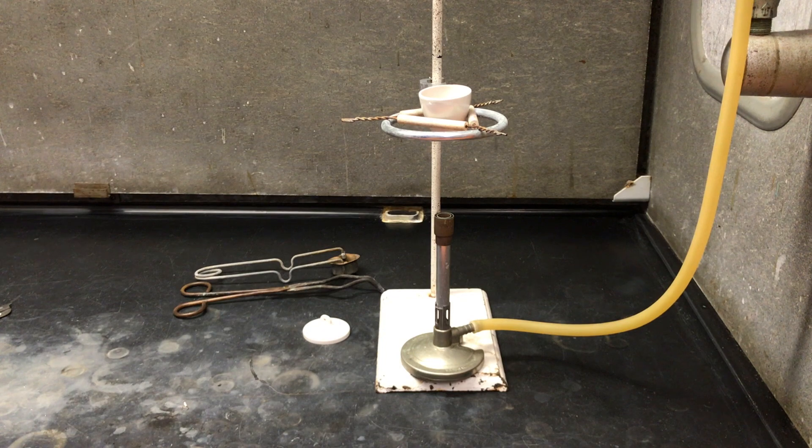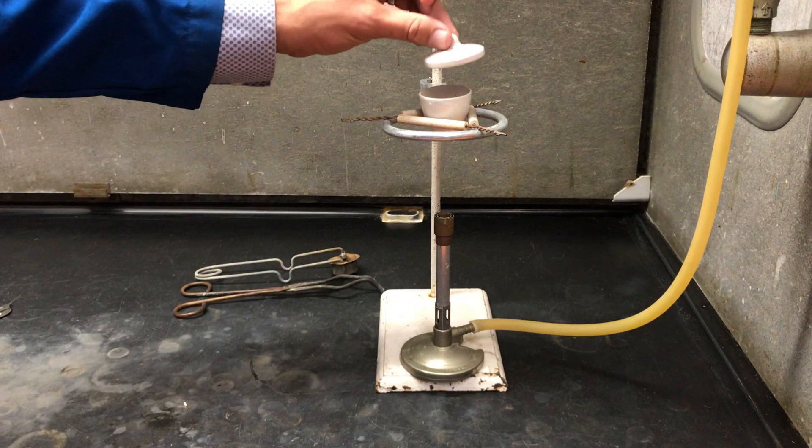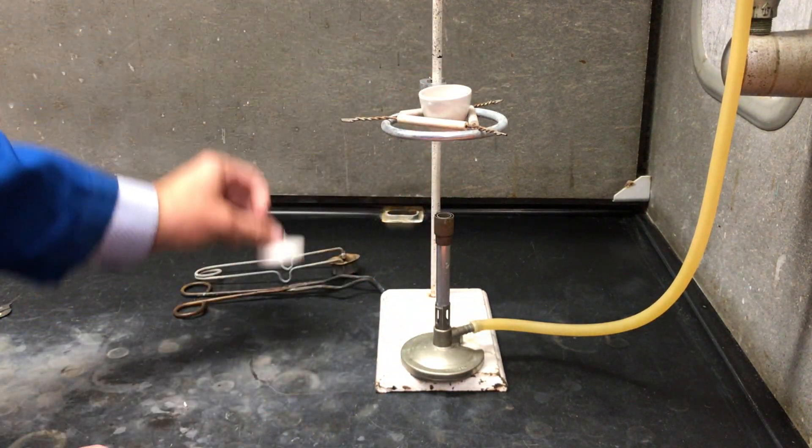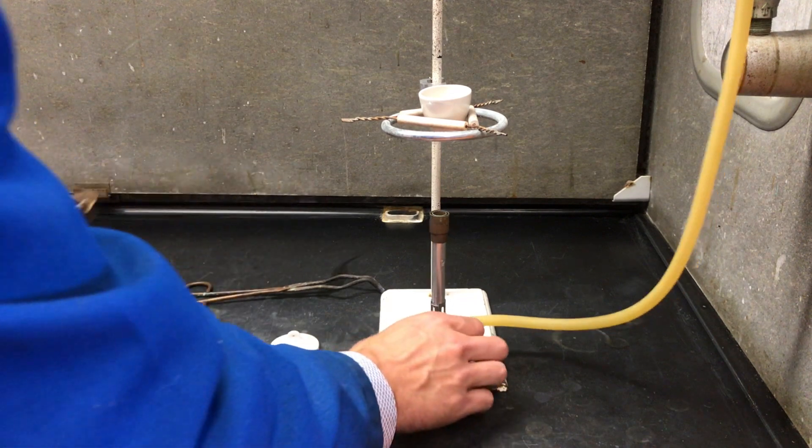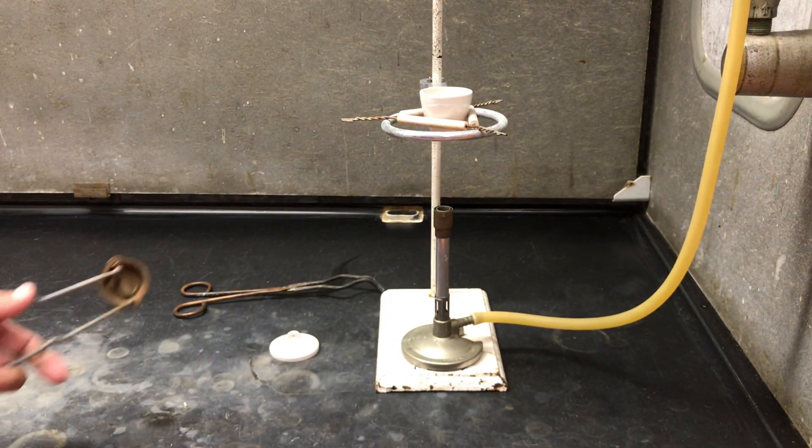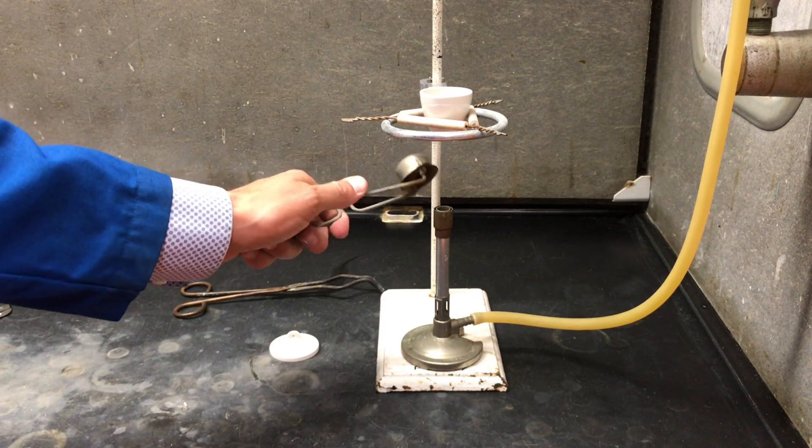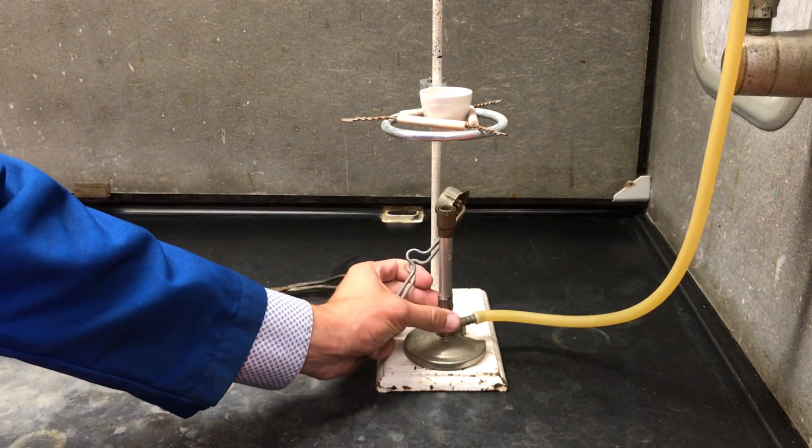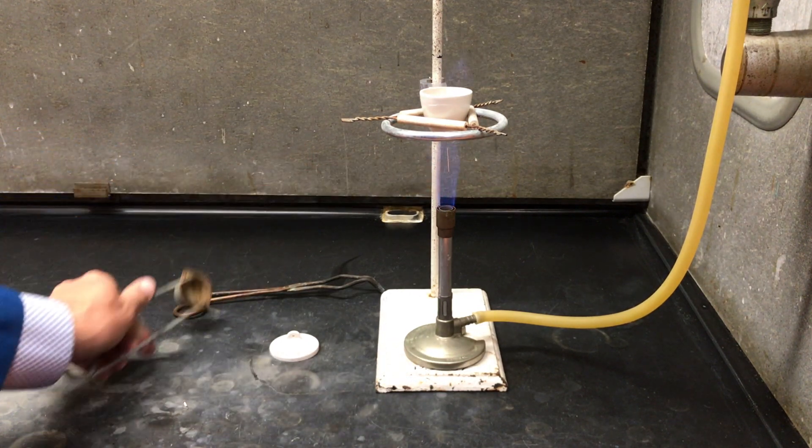Carefully put away your reactants. Remember to not cover the crucible as oxygen is a reactant. Appropriately light the Bunsen burner as described before, ensuring that you start with the oxygen valve closed and then open it.